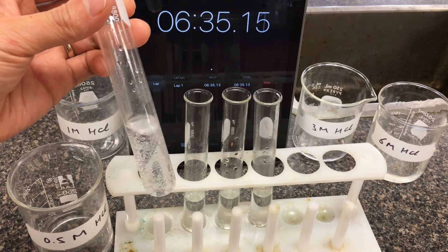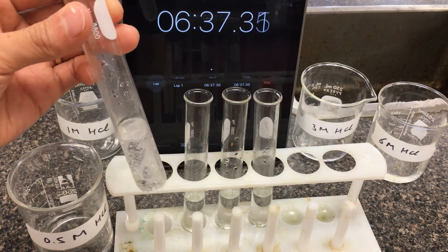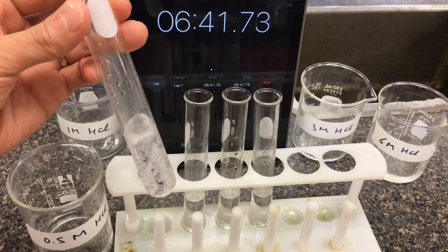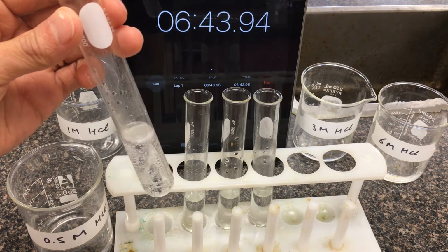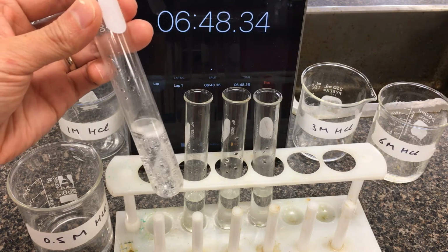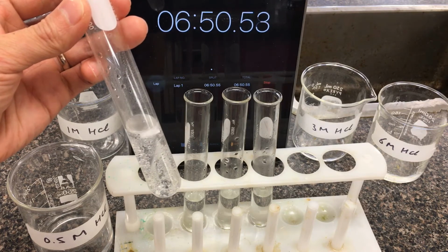When the concentration of HCl gets too low, we might run into some limiting reagent problems here. Maybe there really isn't enough HCl to dissolve the rest of the magnesium, so once it stops bubbling, we can take a reading at the time.